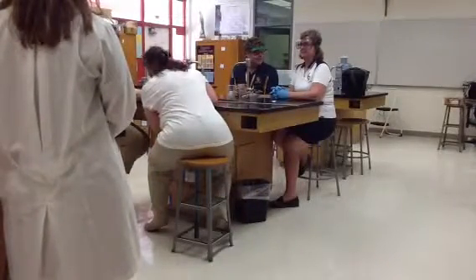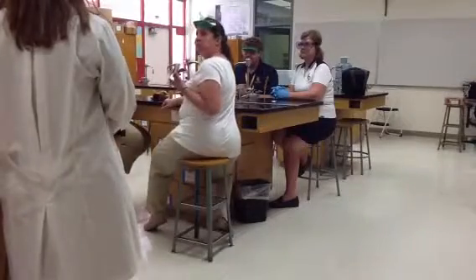Renee, Terry, what are you doing? Put that away. There's no eating in the chemistry room.